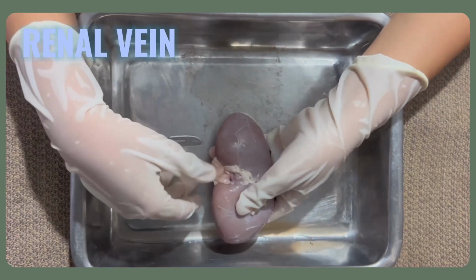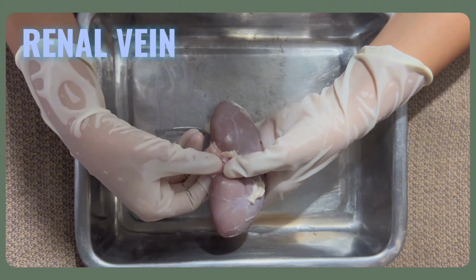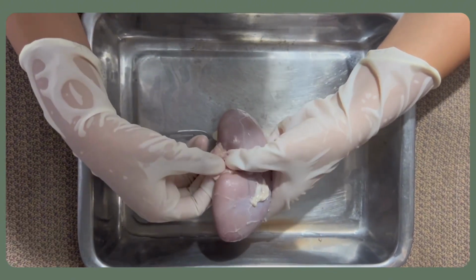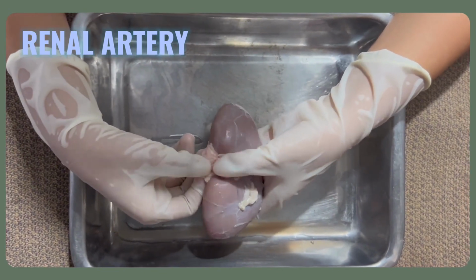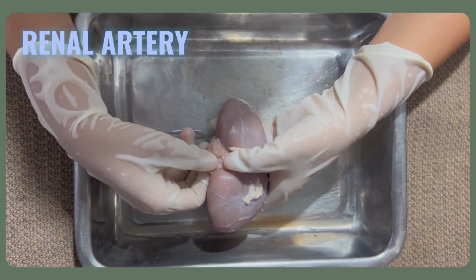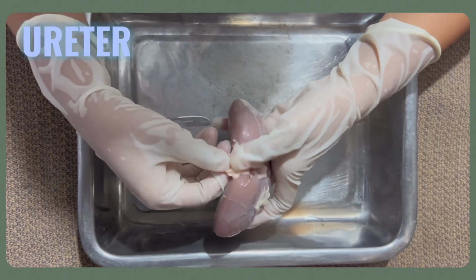Next is the renal vein. This is the renal vein. The renal vein carries blood from the kidneys back to the heart. Another one is the renal artery or renal arteries. The renal artery carries blood from the aorta to the kidney to supply them with the oxygen and nutrients they need to function. Lastly is the ureter.